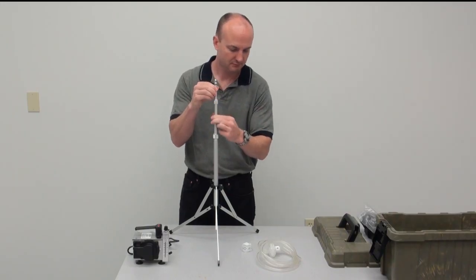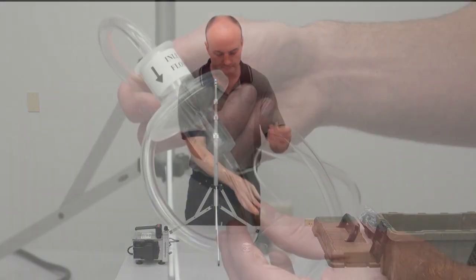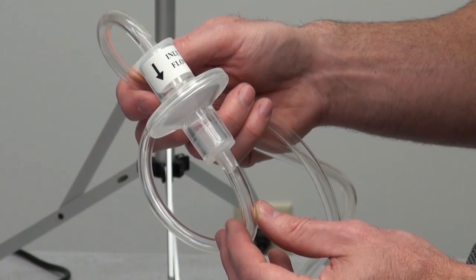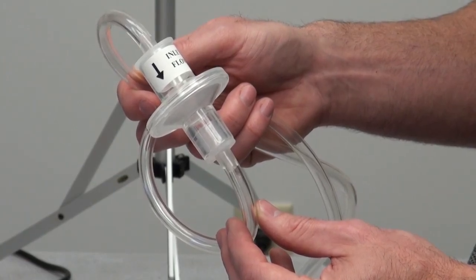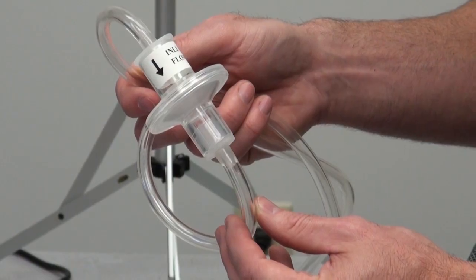A part of the tubing should be attached between the pump and the inline filter. The inline filter protects the pump from becoming contaminated, which could cause contamination at future test sites.